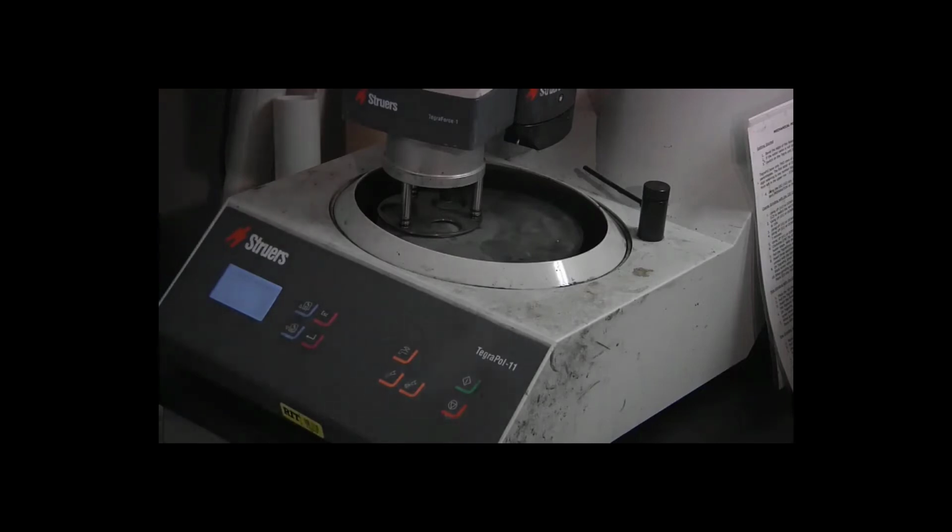Again, it's recognized the presence of the doser bottle and automatically changed the water to off. But the doser number and doser level line is new. It has recognized that the code number, ID number for this bottle is number 4, and it currently has the level set to 10.